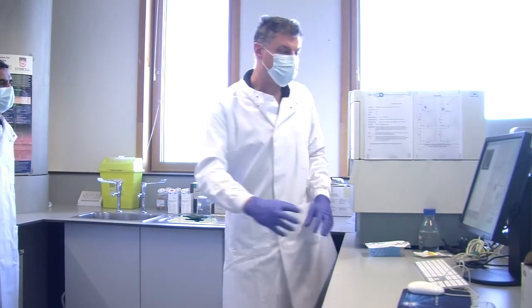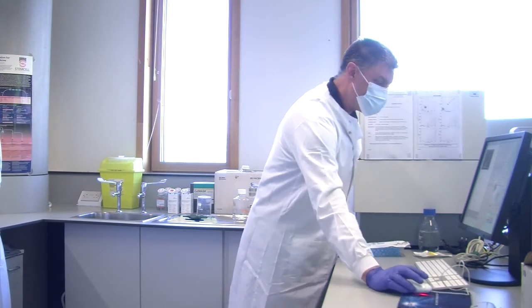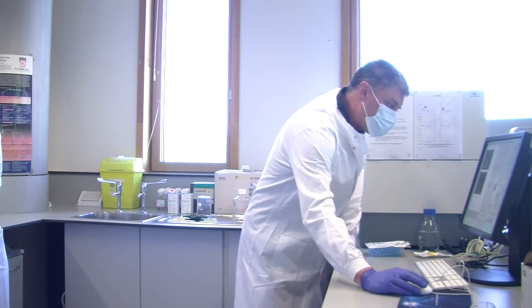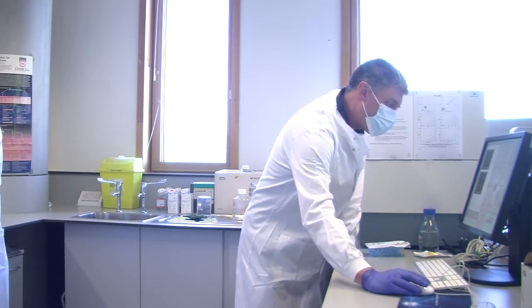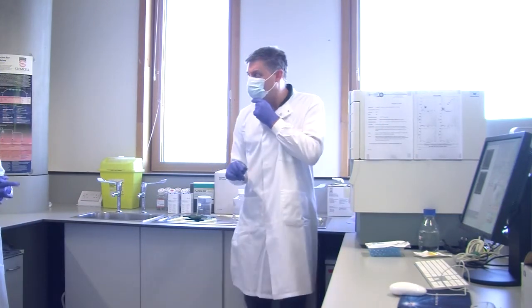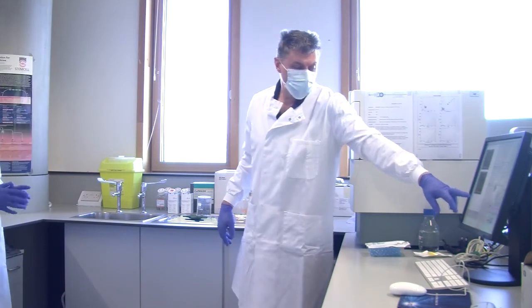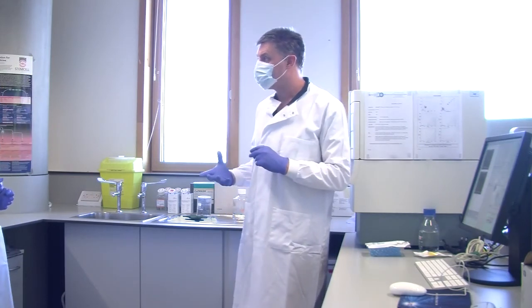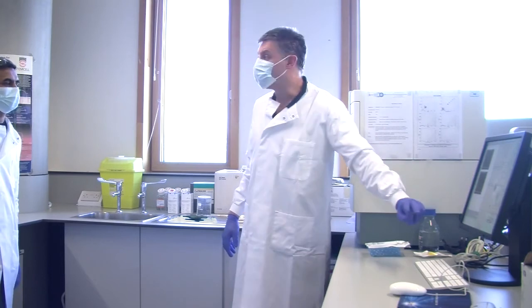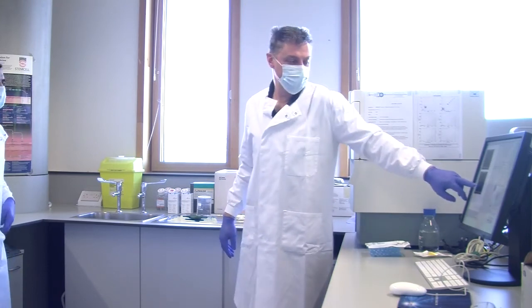But you see, we can look at forward and side scatter. We can also look at some of the fluorochromes. Now, obviously, we don't have fluorochromes in here. What we're now looking at is FL1, fluorochrome 1, versus fluorochrome 2. Fluorochrome 1 is our green detector, so this is any green fluorescence. This is fluorochrome 2, which is orange fluorescence. So this is where we will see our PE.